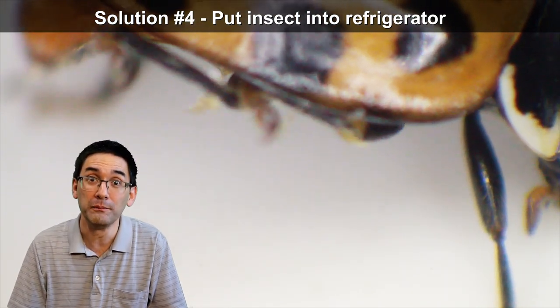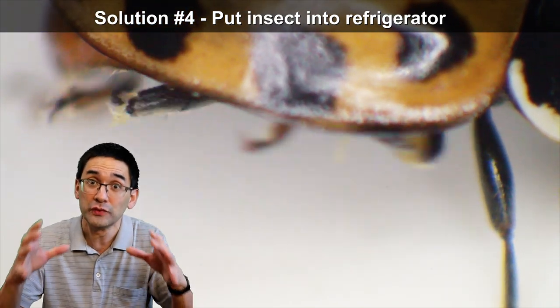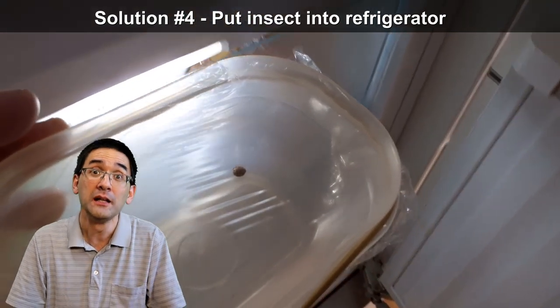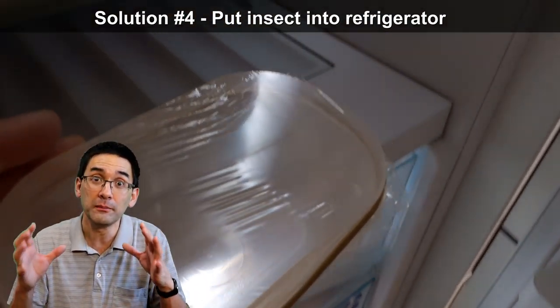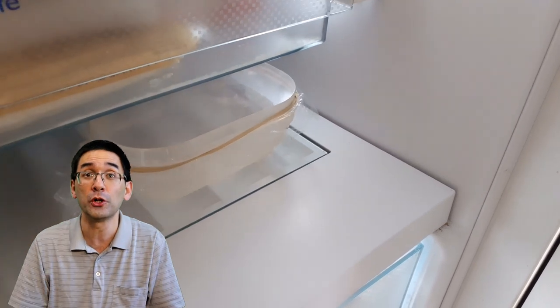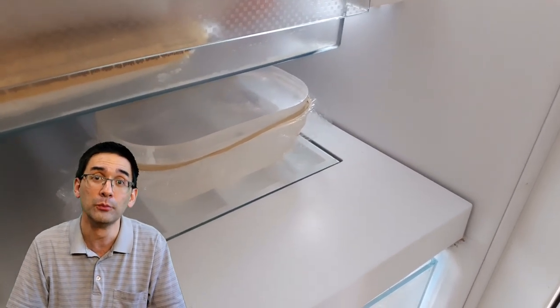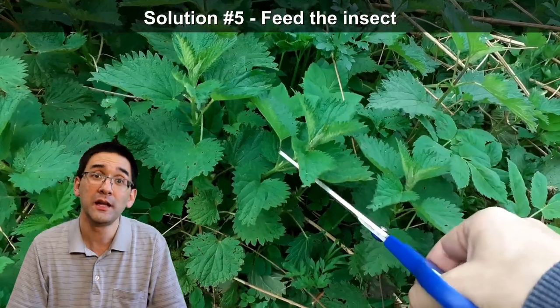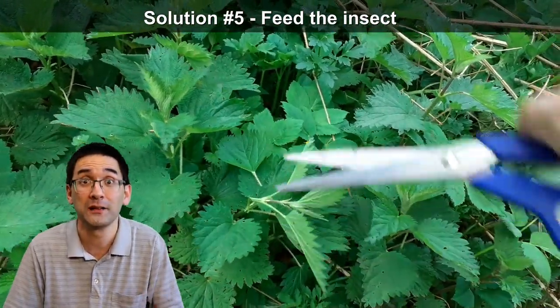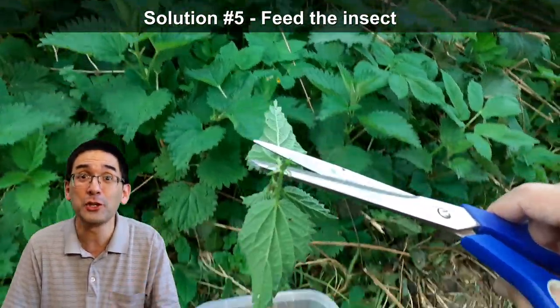If you want the insects to rest very quietly but still don't want to kill them, put the insect in the refrigerator. This will cool them down enough to limit their movement significantly. This is also a method that works for taking pictures of bees and wasps.